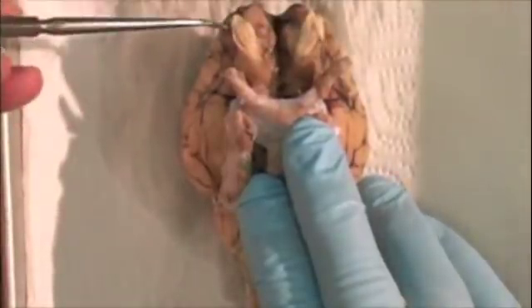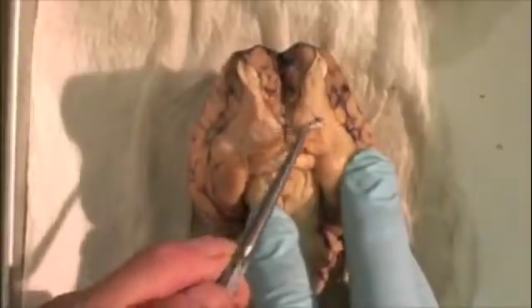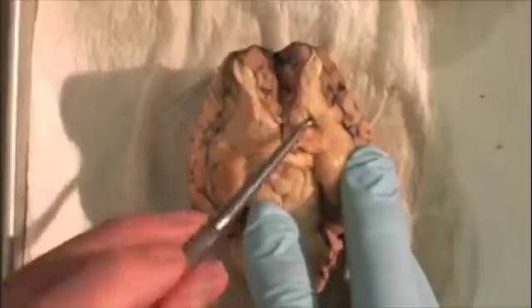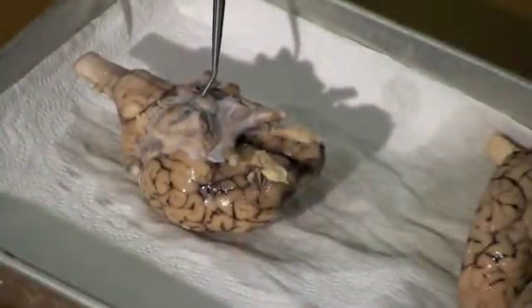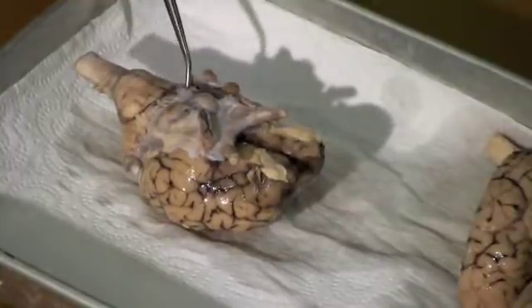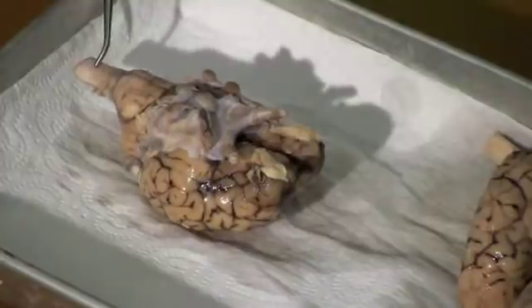On the underside of the brain are the prominent olfactory bulbs, and extending backwards from them a lateral olfactory tract and a medial olfactory tract. Here is the pituitary gland, which is usually removed when the dura is removed, the pons, the medulla, and this is the spinal cord.